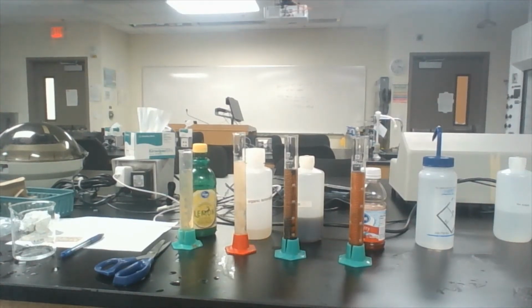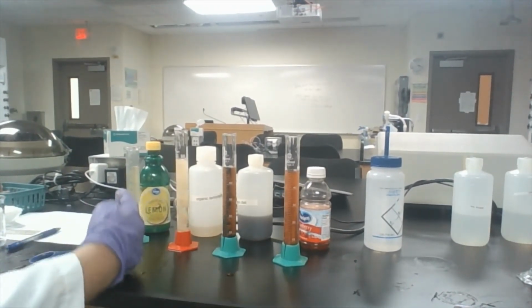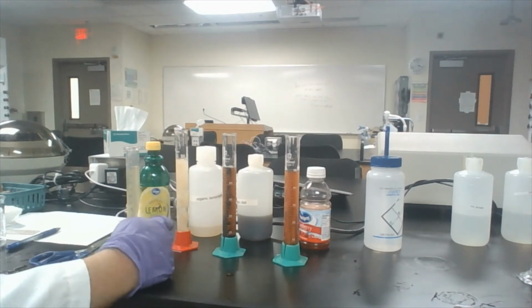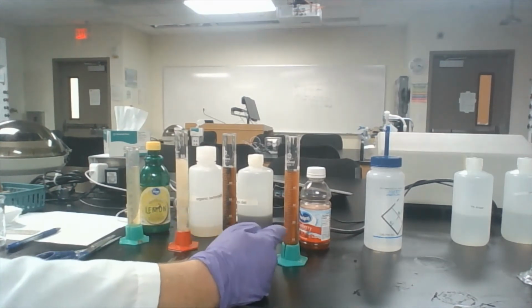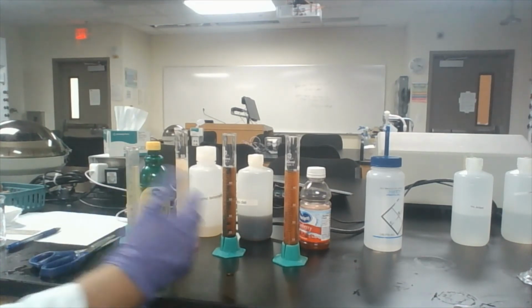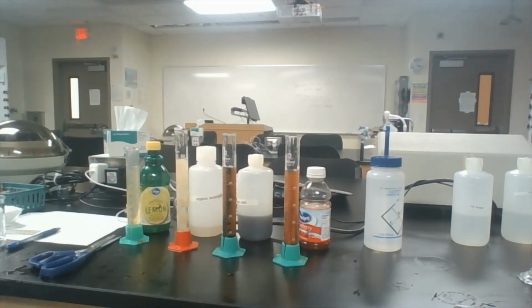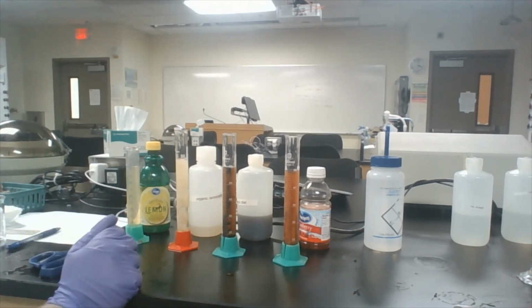All right, I have some unknowns here that are ready to be measured. From left to right, we have lemon juice, lemonade, Diet Pepsi, and cranberry juice. Ordinarily, for purposes of demonstrations, we don't use brand names, but Pepsi may be different from Coke, so it is important to differentiate, or use generic cola, RC Cola, whatever the brand is, because they may vary between them, each of them having their own particular brand and branding.